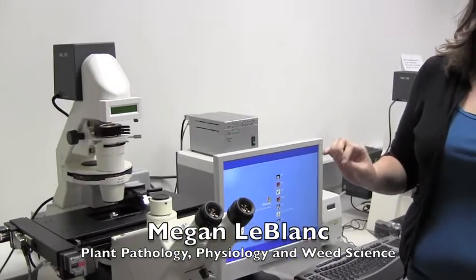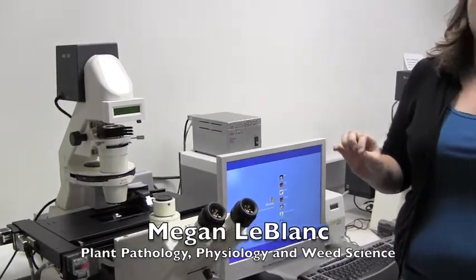In this series of videos, we're going to be demonstrating laser capture microdissection using slides that we generated from the cryosectioning technique that we tried in our last series of videos. The laser capture microdissection system is capable of dissecting small quantities of tissue, which can then be used for downstream applications such as RNA extraction for qPCR or metabolite profiling from a very small number of cells.